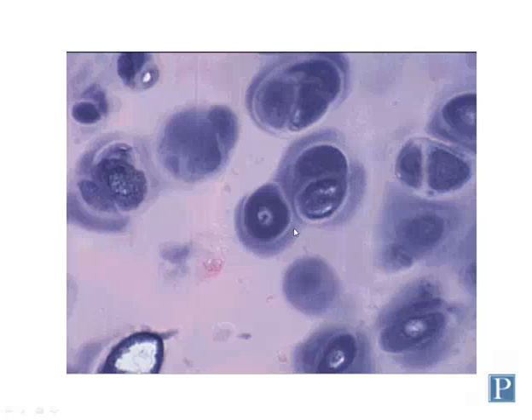This matrix is more acidic, and so it stains more basophilic, and that reflects the fact that it's less mature. As more mature matrix is laid down around it, this more mature matrix is farther apart and is more basic in color and composition, and so stains more eosinophilic.